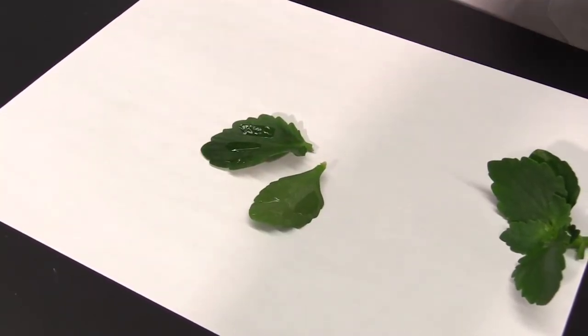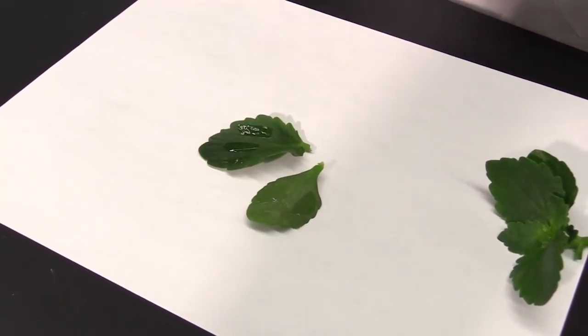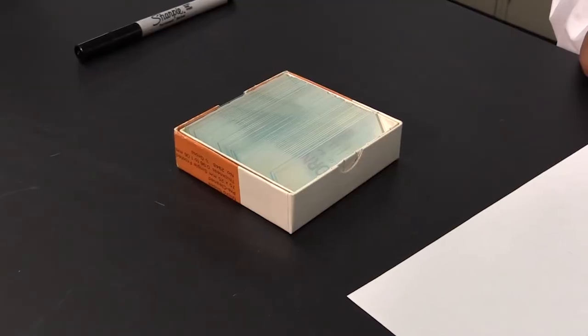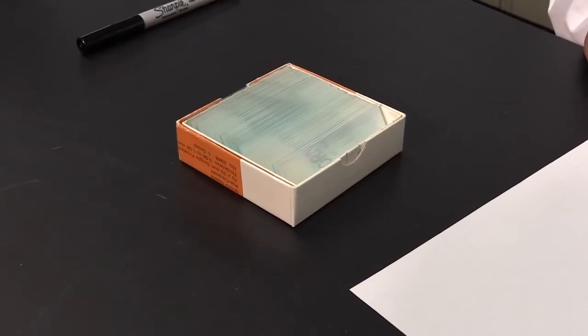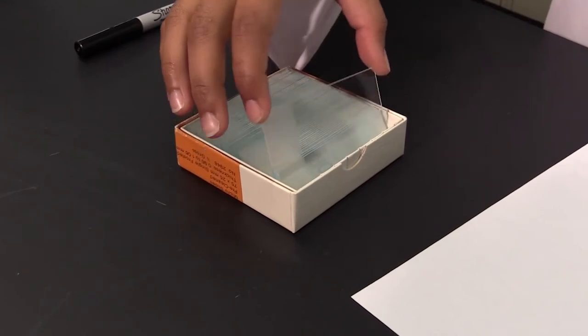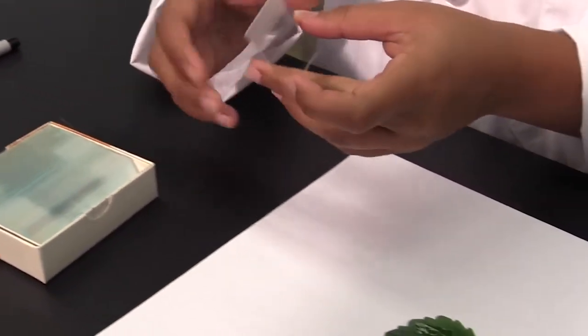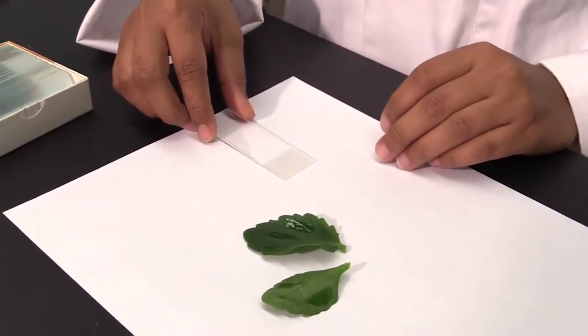Once you've applied your three patches, leave this to set. Now that you've applied your three patches of nail polish, you want to label your slides. This is a very crucial step.